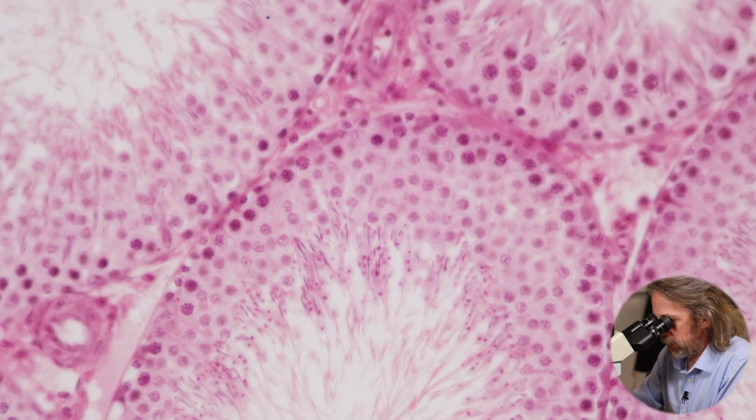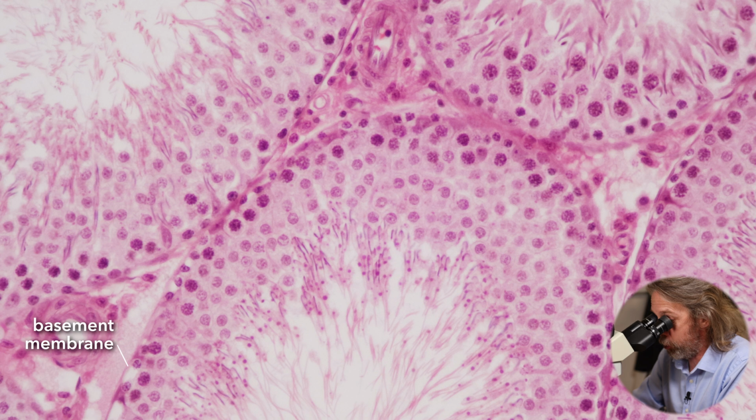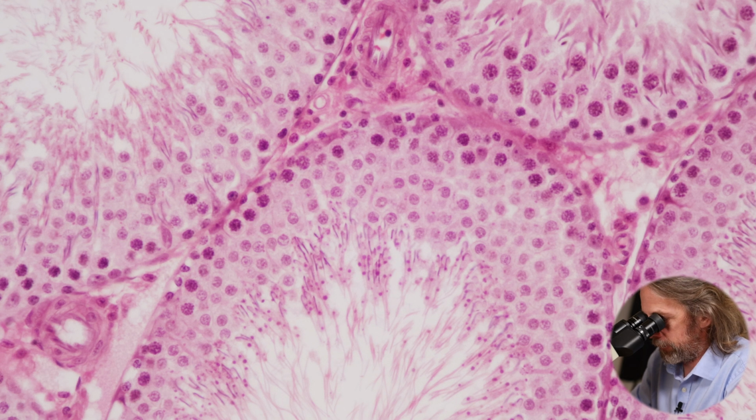There we're looking at the epithelium, and then around the outer edge you can see the basement membrane forming the oval of the seminiferous tubule that has been cut through, and you can see cells with darkly staining nuclei around the outer edge. Those are the spermatogonia. And you can see other cells then, as we move towards the lumen, the center of the tube, but still in those layers of cells of the epithelium, there are cells with large nuclei and not a lot of cytoplasm. The nuclei are still fairly darkly staining.